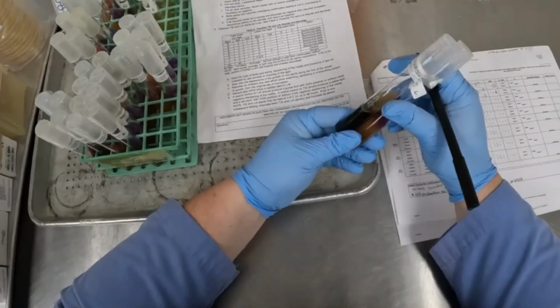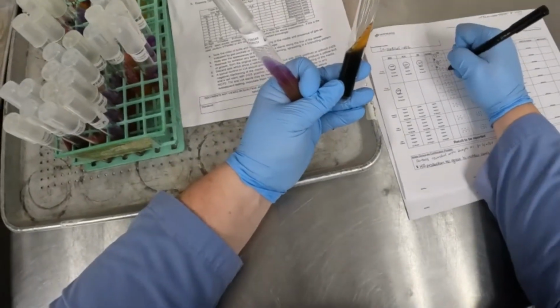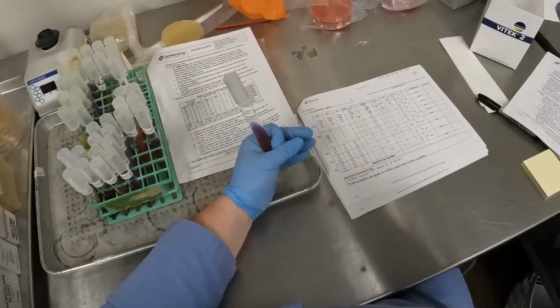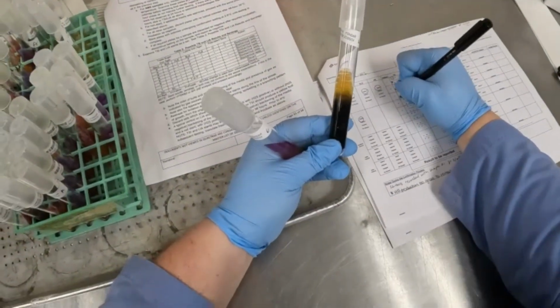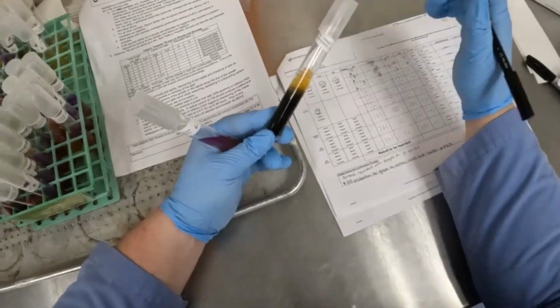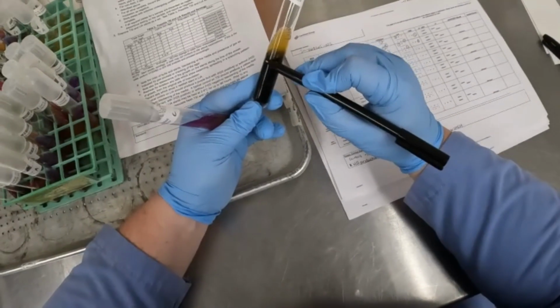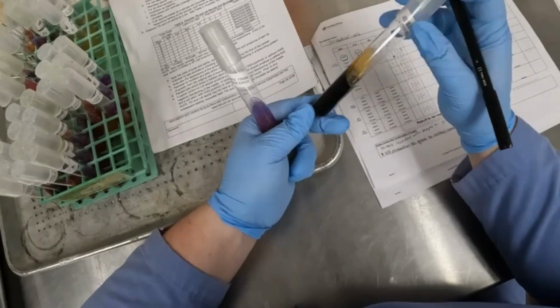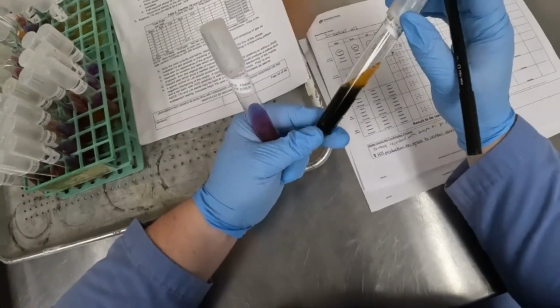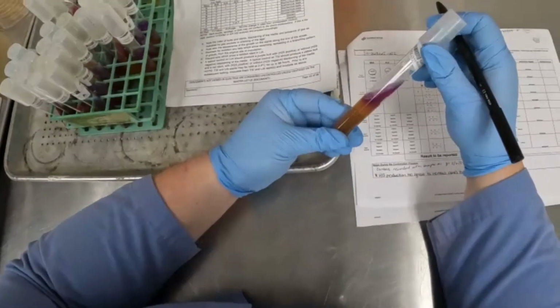For isolate C, we have a full yellow slant. And then once again, that H2S production just took over that butt. So I'll put another little asterisk here just to notate. It does have H2S production and it does have gas. You can see a big air pocket right here. Lots of air down below. It's almost pushing the whole agar up the tube as a whole. And then looking at the LIA.